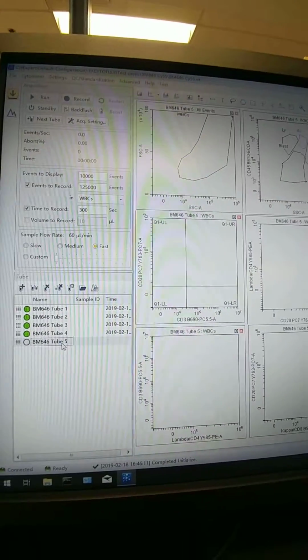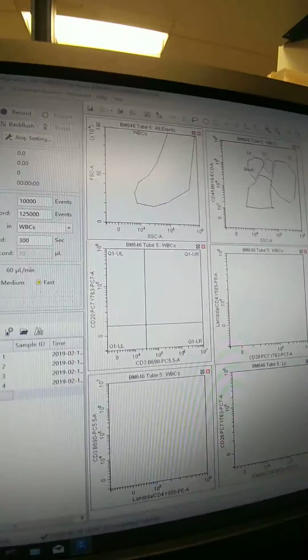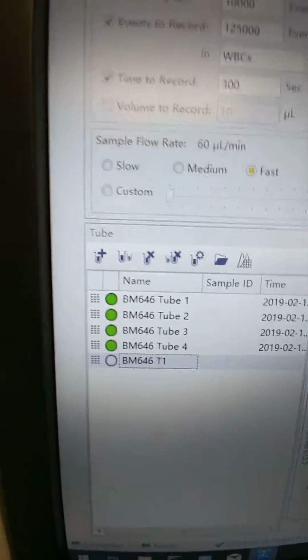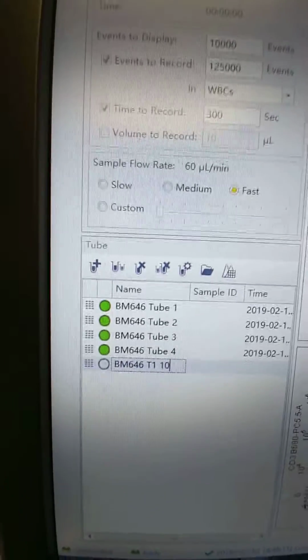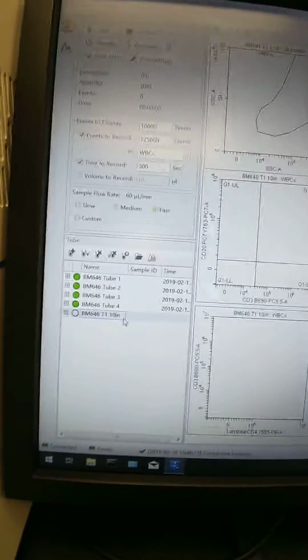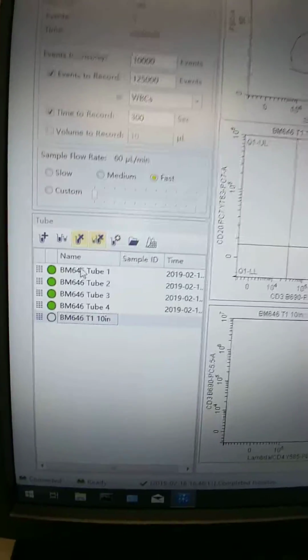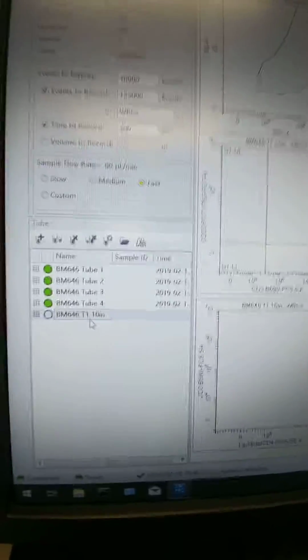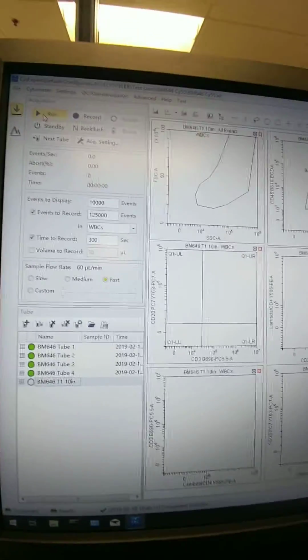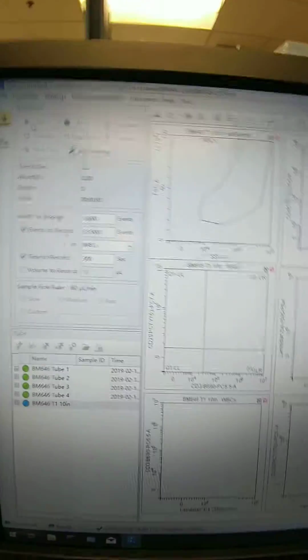Okay, and you actually can change that here. And we'll say 2, we'll make it the BM646 T1 10 increase. I'll just put IN for increase. Okay, and that way it won't overwrite the data up here. It'll be easy when we go to analyze to tell which list mode files I want to look at. Alright, so we're going to hit run.